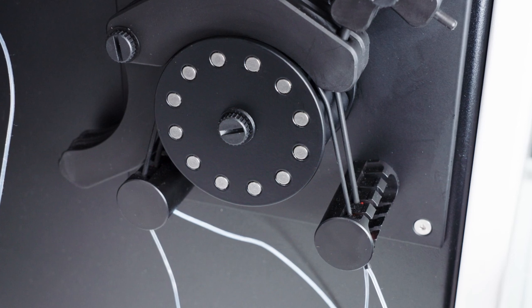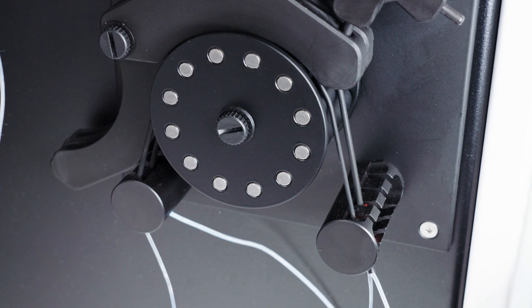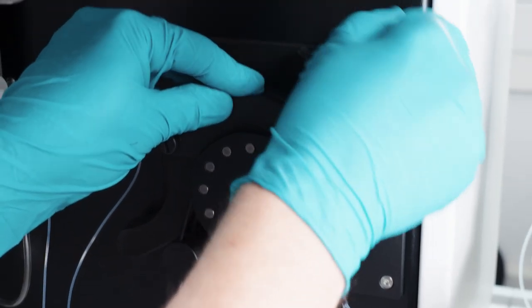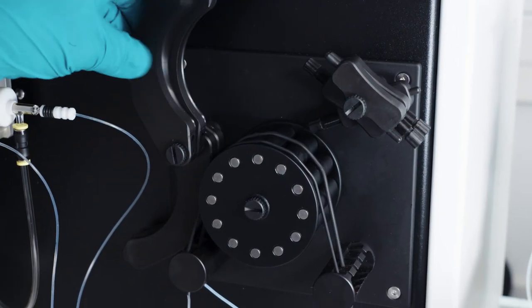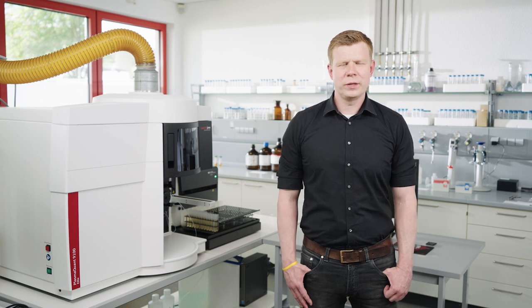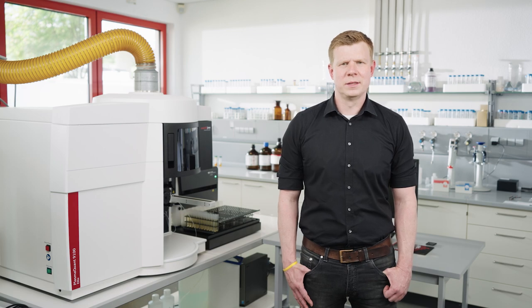The pump tubing should be visually inspected at regular intervals. Worn tubing can be recognized by flattened pump tubing material, which results in irregular flow rates. This, in turn, can affect the precision of the measurements. To enhance the lifetime of the tube material, they should be completely relaxed after finishing the ICP-OES measurement. Since pump tubing can accumulate sample material over time, heavily used tubing material can contribute to elevated background levels in blank standards and samples. Therefore, we recommend changing the tubing material frequently.